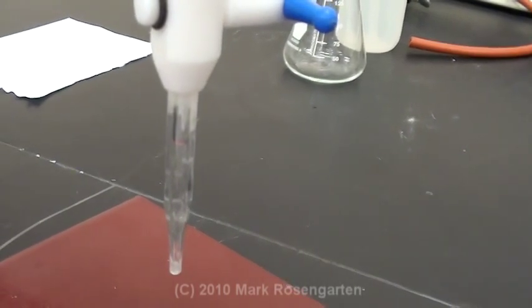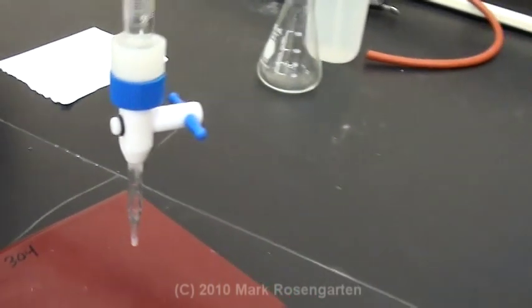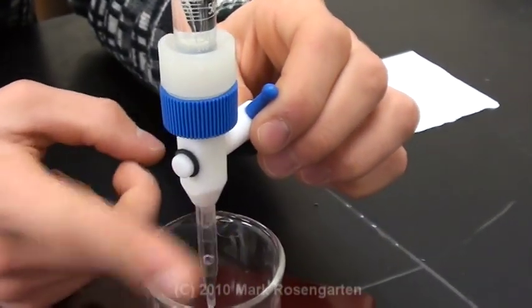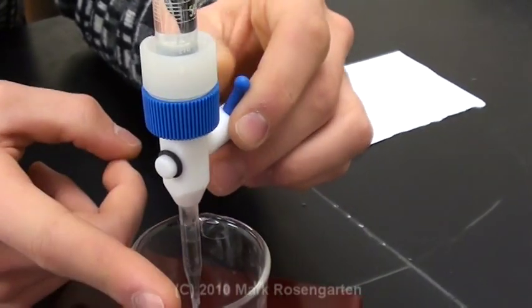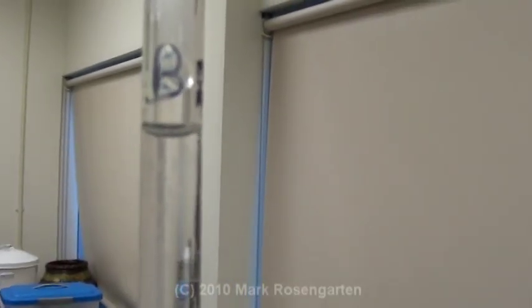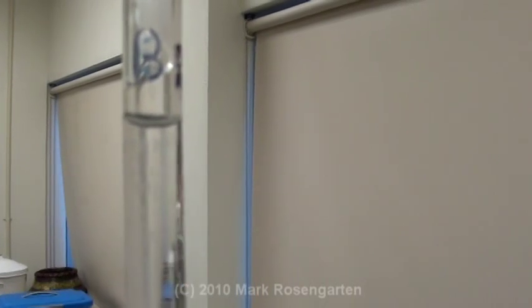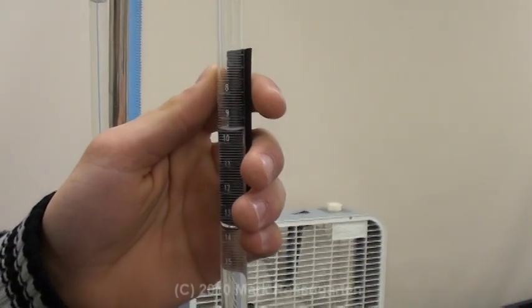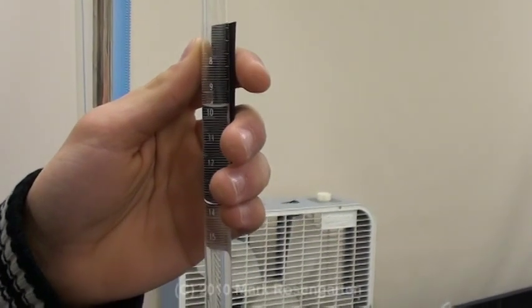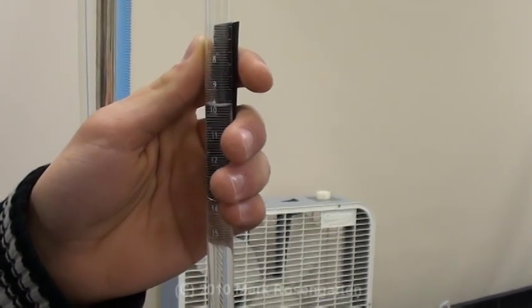The first thing you need to do is get the air bubbles out of the tips. Tap out the air bubbles and continue draining until the level of the base is at zero milliliters. Drain out the acid until you have exactly 10 milliliters of acid.